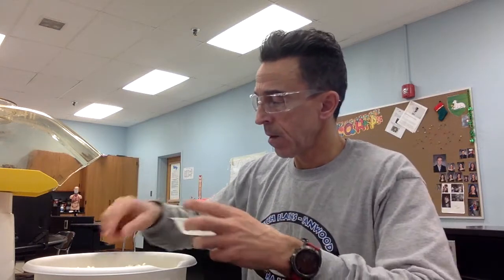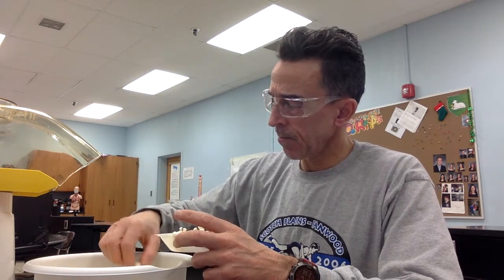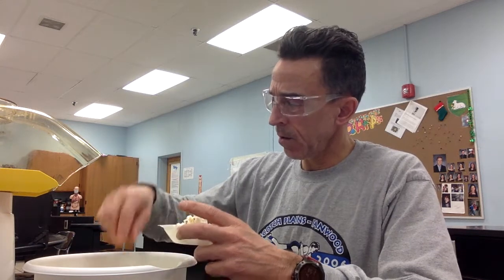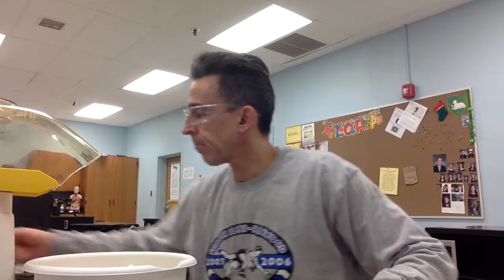But that's 1, 2, 3, 4, 5, 6, 7, 8, 9, 10, 11, 12, 13. Ooh. Let me get other ones. 14 and 15. And I'm going to get it over here to the balance.